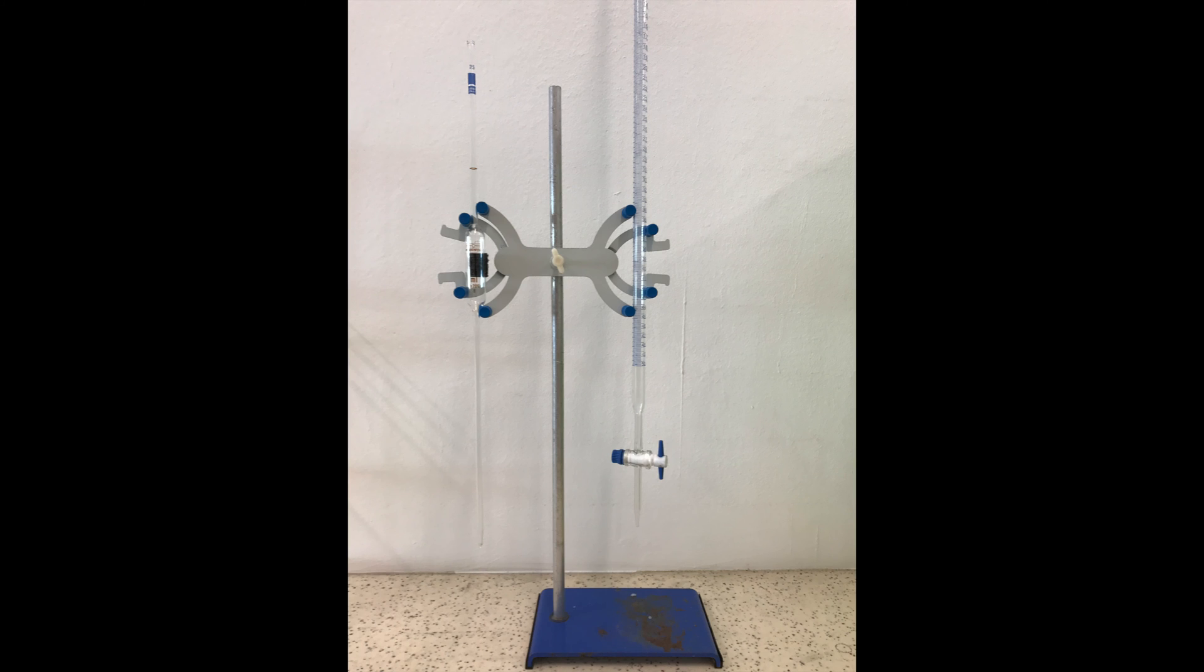Before we move on, it is important to check that both the burette and the pipette are secured. Look from the side and make sure that they are vertically positioned.